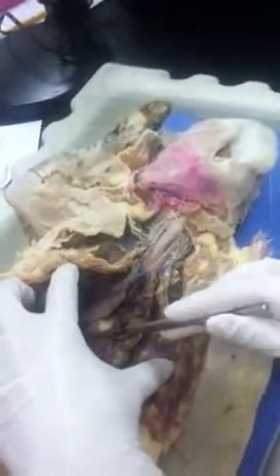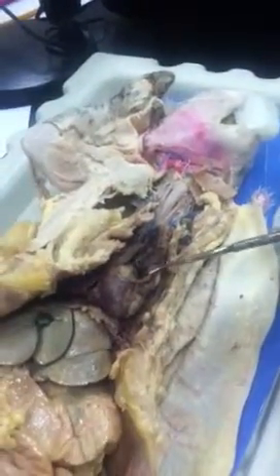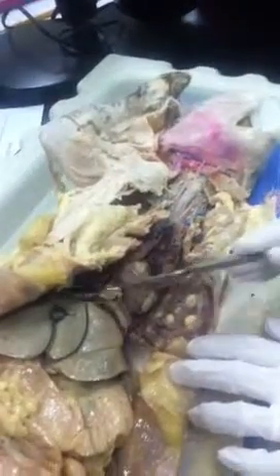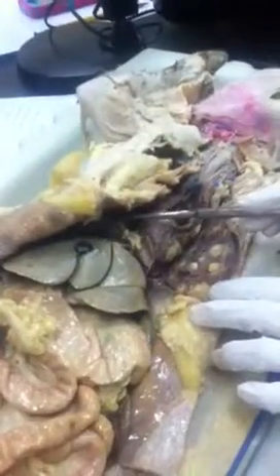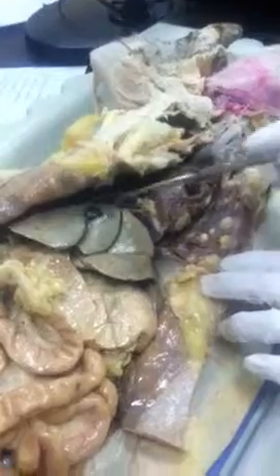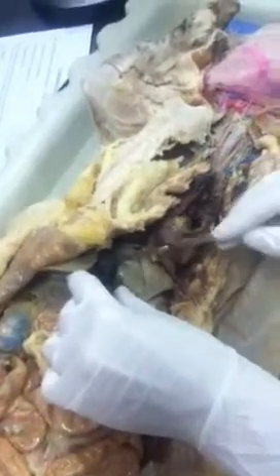Heart, and then we have the lungs. Remember, for the lungs, you need to go left or right and what lobe it is. The diaphragm is what separates the mediastinum from the abdominopelvic cavity. So there's the diaphragm. Okay, you have the liver, and then the structure just posterior to that, kind of embedded in the fold, is the gallbladder.